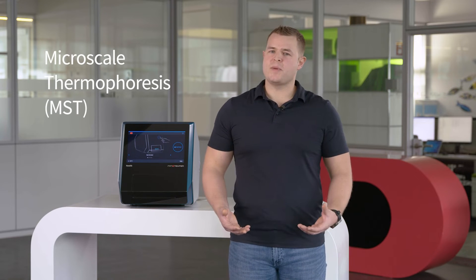Spectral shift technology measures interactions completely independent of mass or size changes. This allows the Monolith X to find KDs even when other methodologies fail or you struggle to get enough material to work with. The second technology is MST. Similar to spectral shift, MST measures variations in fluorescence. However, in this case, a very precise laser changes the temperature of the system by 2 to 5 degrees Celsius. The changes in fluorescence from the fluorophore in response to that temperature change are impacted by the bound state of your target, and the change is plotted against ligand concentration to obtain the KD. MST can also provide an in-depth understanding of your sample quality, helping you differentiate between binding events and aggregation.